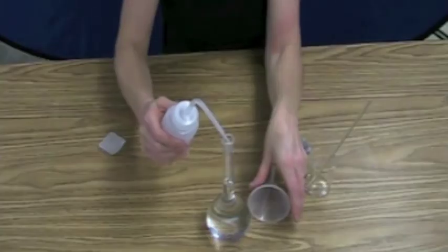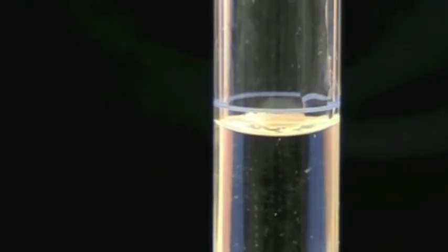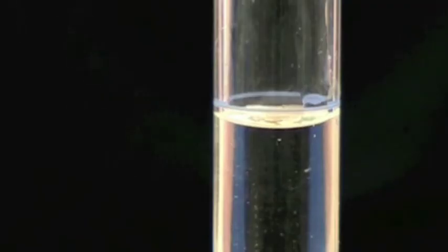So I put the little lid back on, and now I'm just going to put it in drop by drop. And there's only one line on a volumetric flask. And you have to get it right on the line to make sure you have the correct volume.